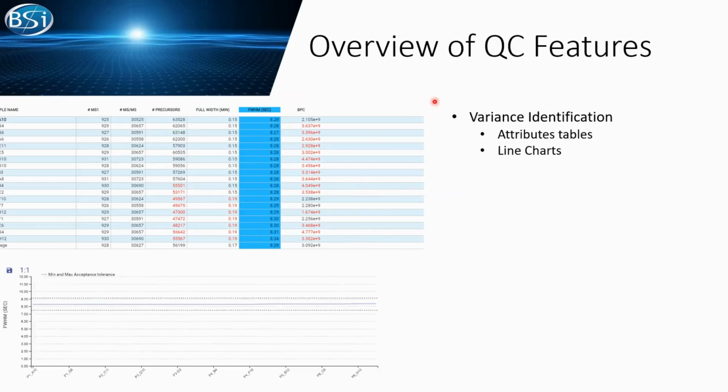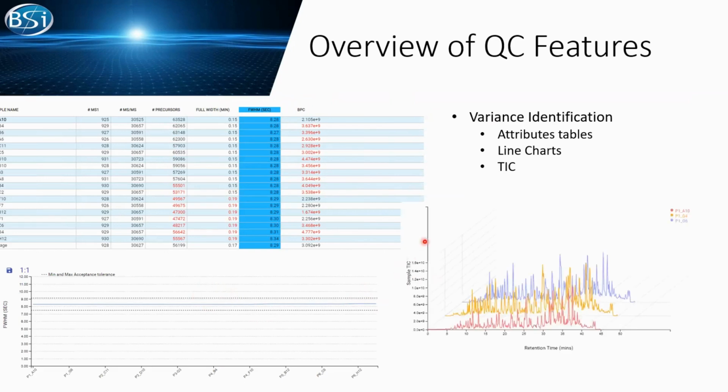And to give you a direct view of your attributes matrix, you can simply click on any column, and you will get a line chart to give you a more direct view of the attributes. We also provide a TIC chromatogram to help you have a quick view of your sample's run. You can select any sample to be presented here.